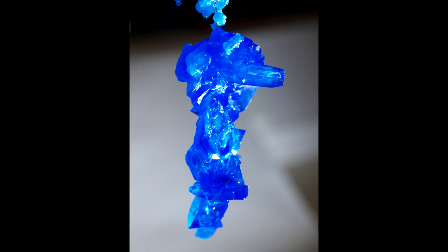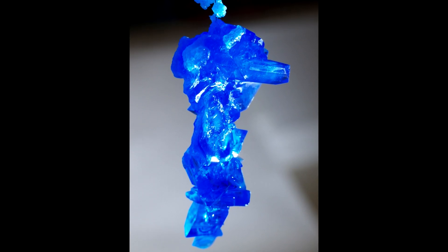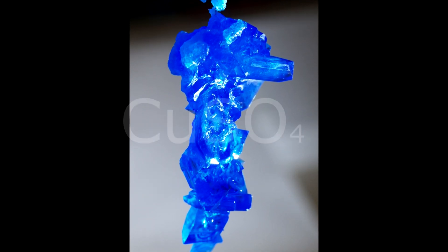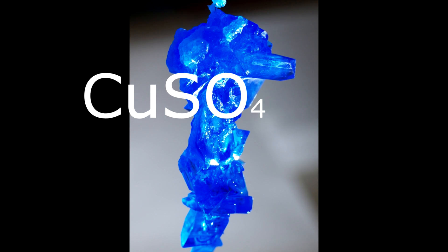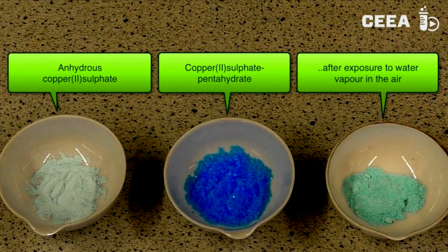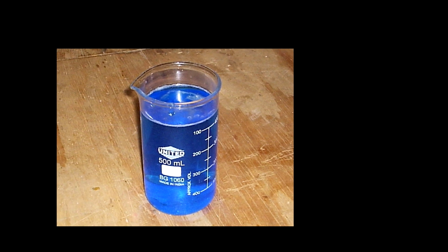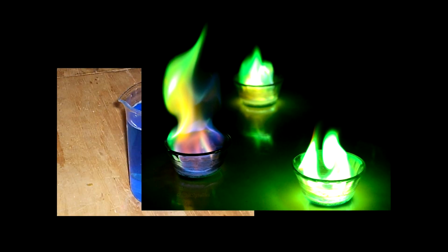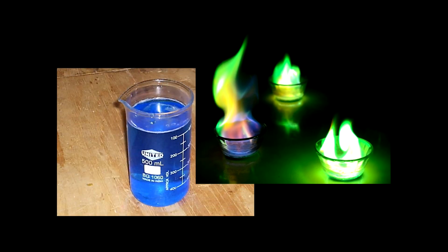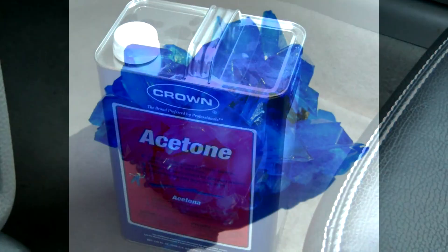Today I'll be talking about copper sulfate. Copper sulfate has the chemical formula CuSO4. This salt in its pentahydrate form is a rich blue color, and its anhydrous form is off-white. It is soluble in water and methanol, but is insoluble in ethanol and acetone.